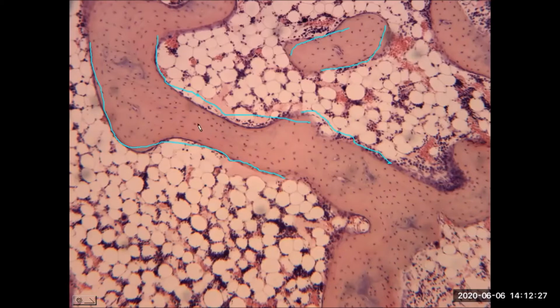And now embedded within the trabecula, seen here, these purple dots embedded inside, these are osteocytes, the mature cells. So the osteocytes, whereas the purple cells bordering right on the edge of the trabecula, so we've got to look at location now. The purple dots represented here are truly just the nuclei of the osteoblasts. So the young, more active cells. Osteocytes embedded deep inside the trabecula. Osteoblasts on the border of the trabecula.